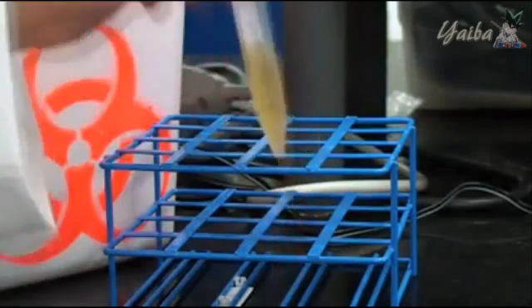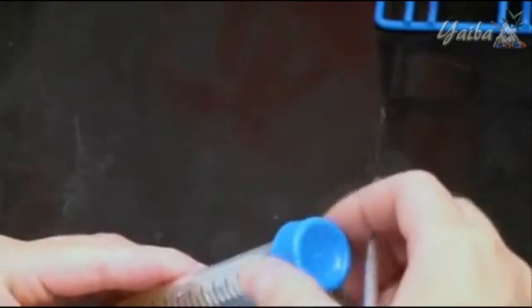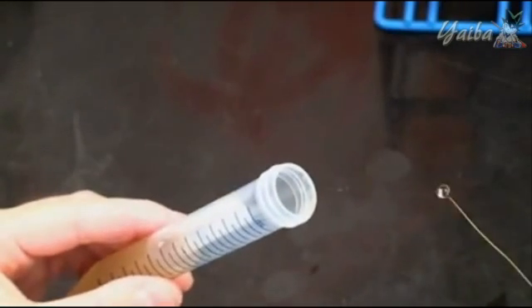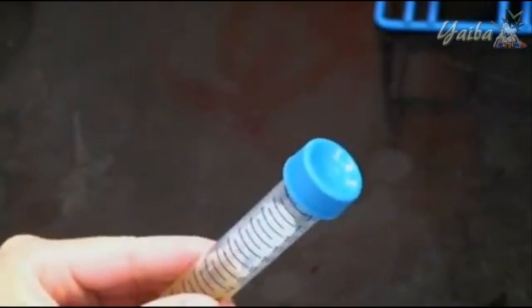When taking bacteria from a culture in liquid media, start by removing the cap from the container without placing it down. Once the cap is removed, use the loop to collect a small portion of the culture, and return the cap to the container. As always, be mindful of contamination. A hot loop is not a concern with liquid media, as it will be safely cooled on contact.